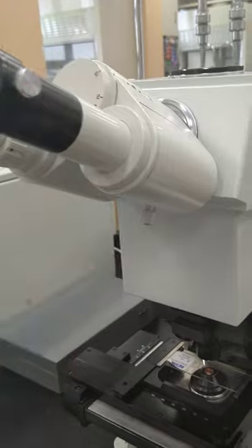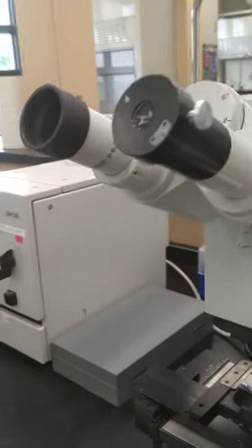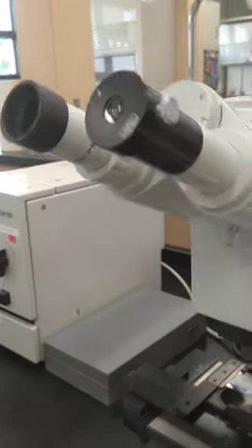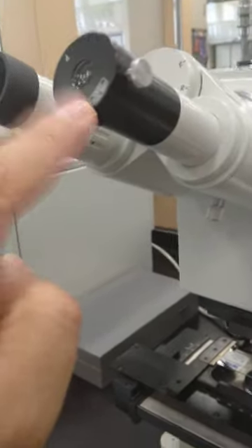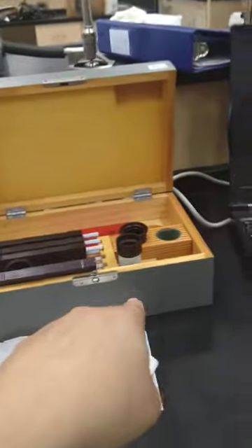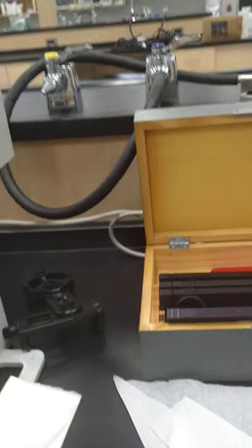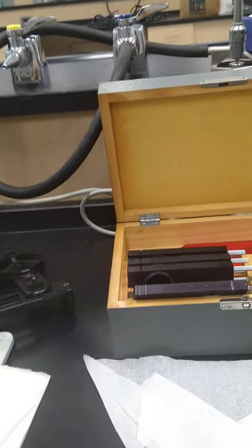Be very careful with this part. You just have to put this one here and the other one you can put here. Now let me show you the next step.